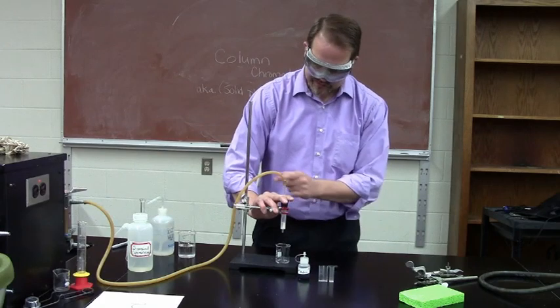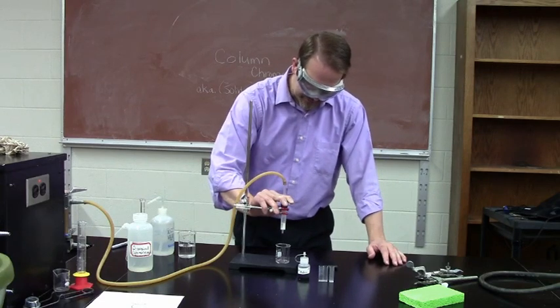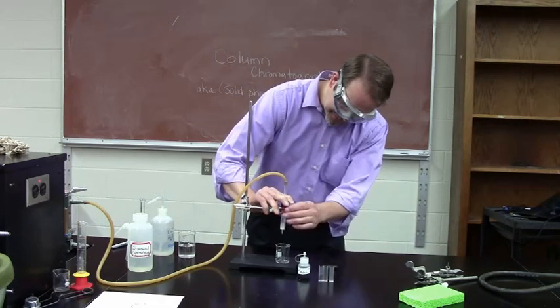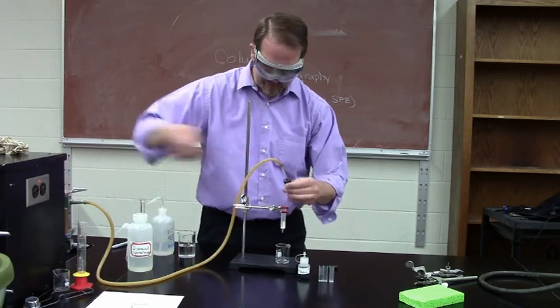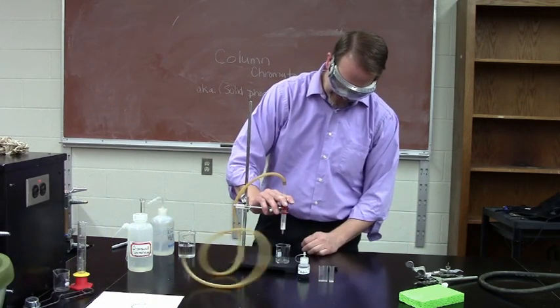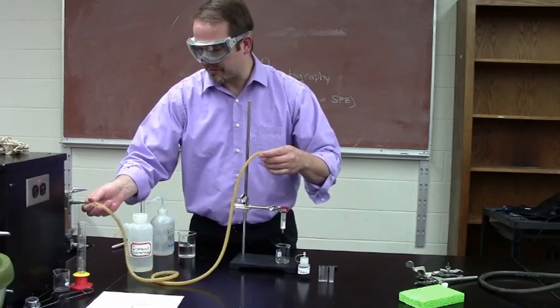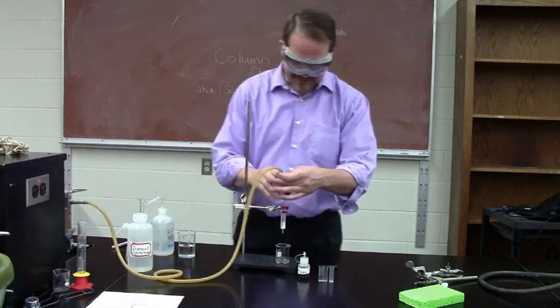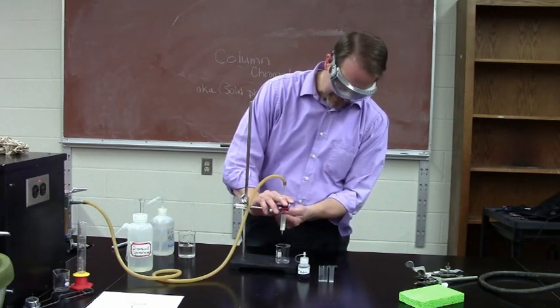Now you'll be able to find the ring stand and some holders for your column in the lab, in your common areas. So I'm trying to push some more of the liquid through to get it conditioned. So I do have to press quite firmly for it to push through. And we can see the water now coming out rapidly. Get that on nice and tight.